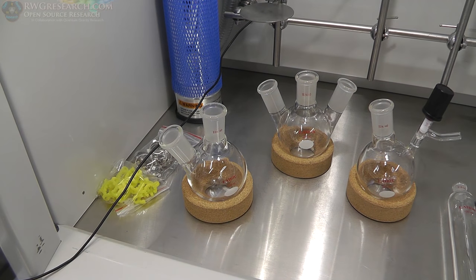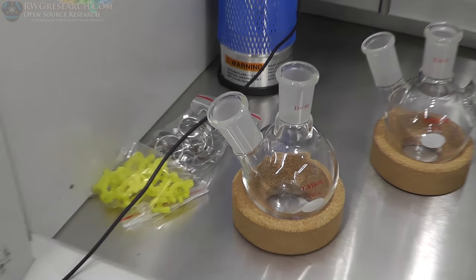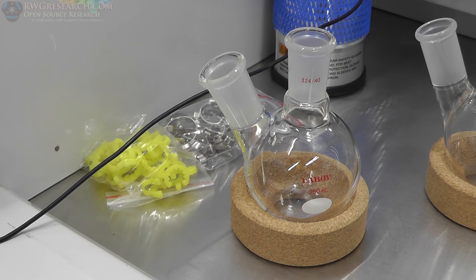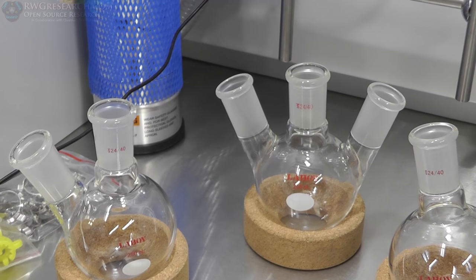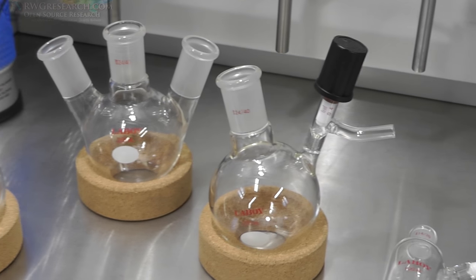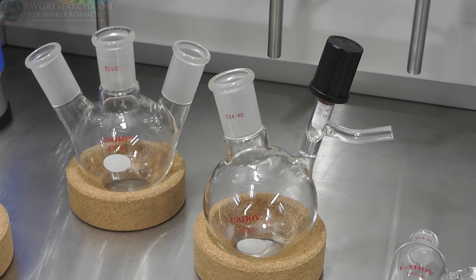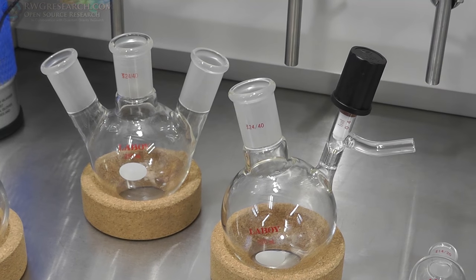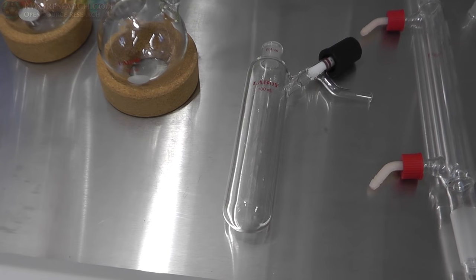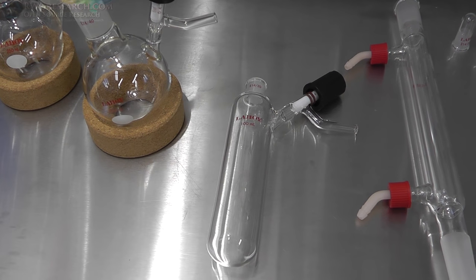So briefly, let's show you guys exactly what kind of things can go on this system. So this is a two-neck round bottom flask. This is a three-neck round bottom flask. These are usually for reactions, by the way. This is a single-neck round bottom flask with a vacuum inlet. PTFE vacuum valve. This is a different style reaction flask. It's a cylinder type with also a vacuum fitting on it.